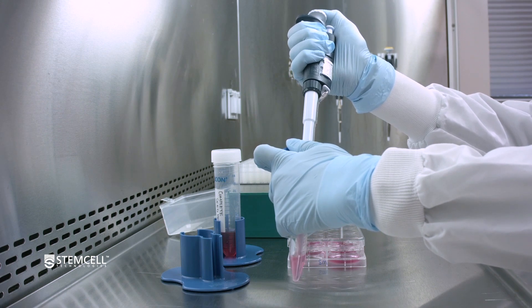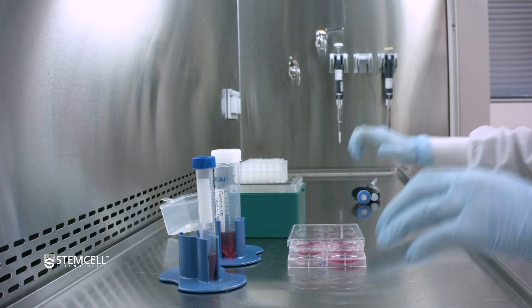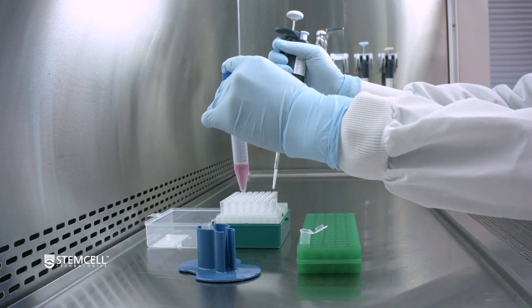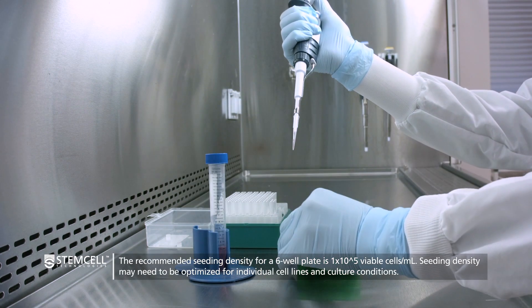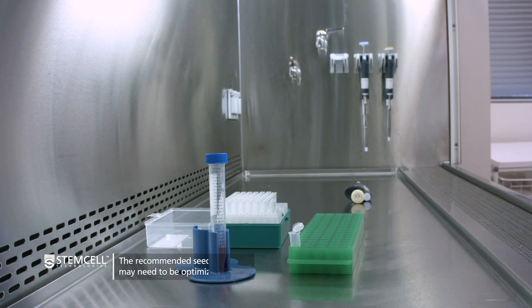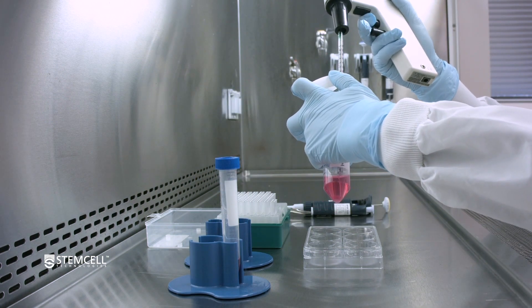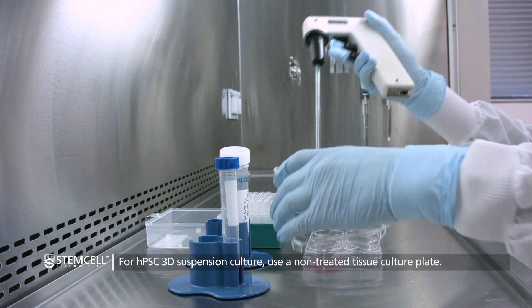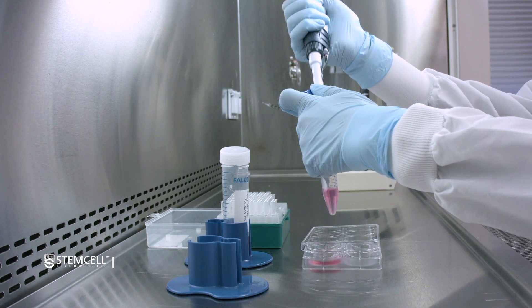Triturate the aggregates as required to achieve a uniform final clump suspension with aggregates 50 to 200 microns in diameter. Remove a sample for viability and cell counts. Determine the volume of cells and complete seed medium for seeding. The recommended seeding density is 1×10⁵ cells per ml. Add the required volume of complete seed medium with Y27632 to the wells first, followed by the required volume of cell suspension.